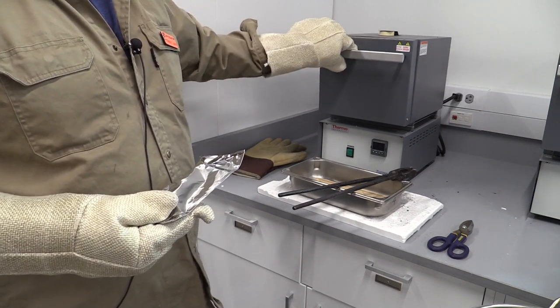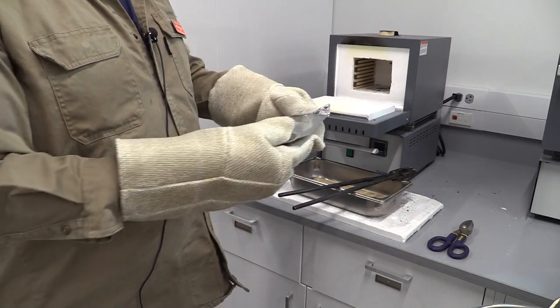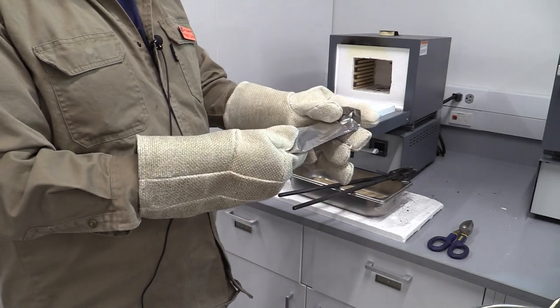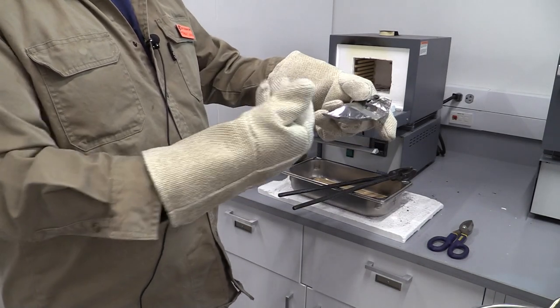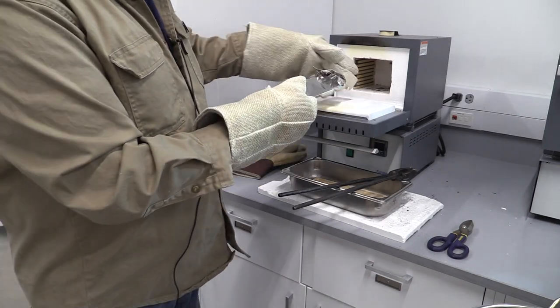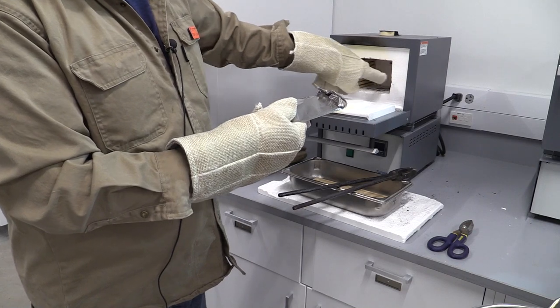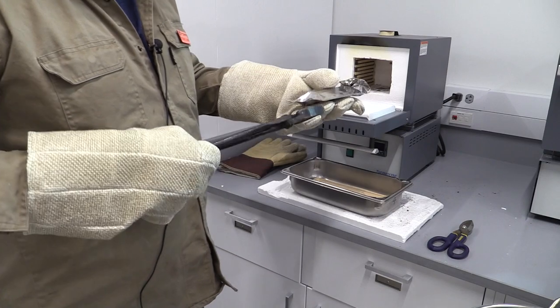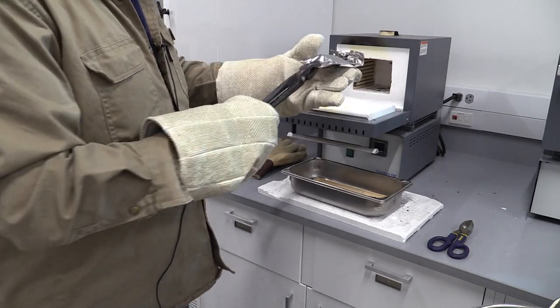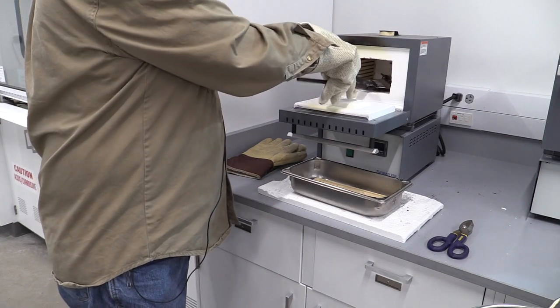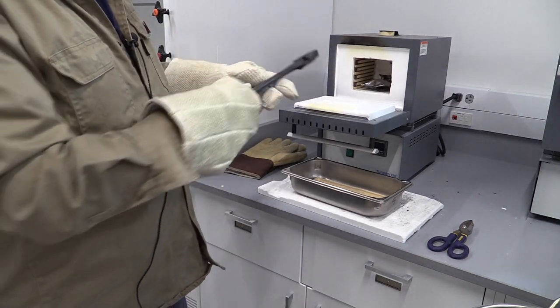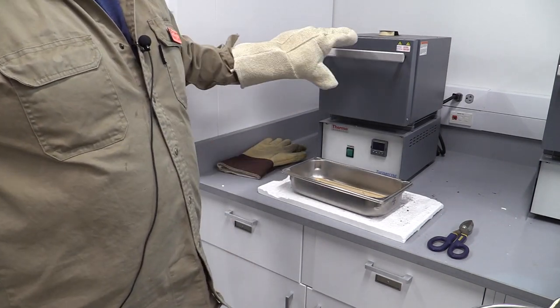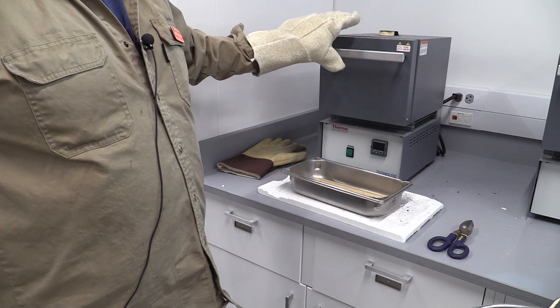Currently I have my furnace off just for demonstration purposes. I'm going to open it up. When I have my pouch it's going to be too long to put in the furnace, so I'm going to kind of crank one side up. I know my washer's on this side so I'm loading that to my side, putting it in here. We want to make sure we stay clear of the hot coils on the side, not touching them. You're not going to load with gloves - you need to have your tongs and load that in when it's hot. I can push it in where I can get my sample without touching the sides. My sample has been folded up on the rear and I'm going to close that and let it soak for the designated time at temperature.